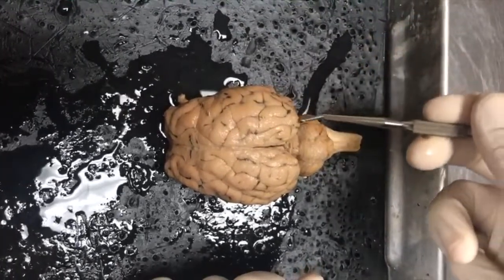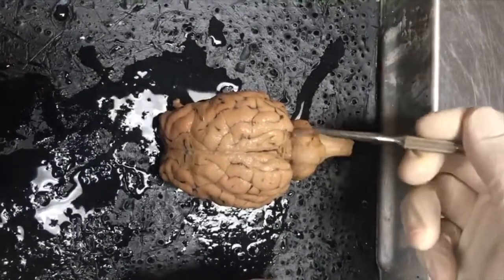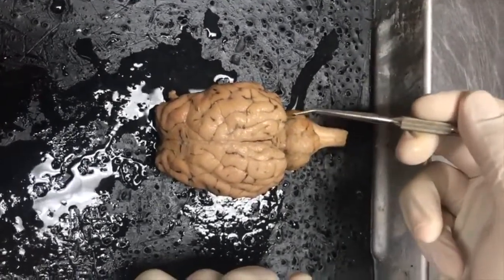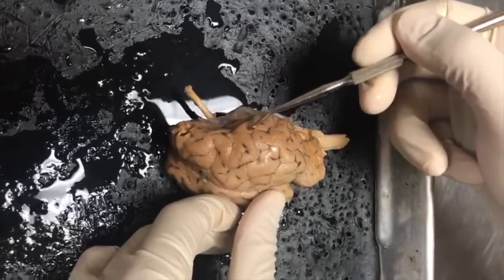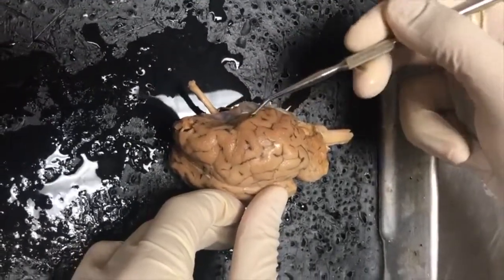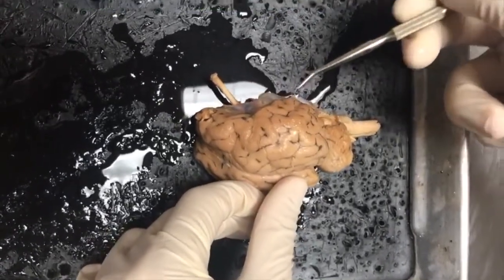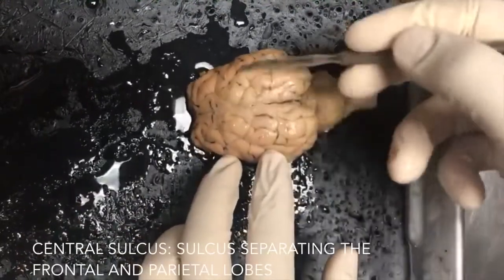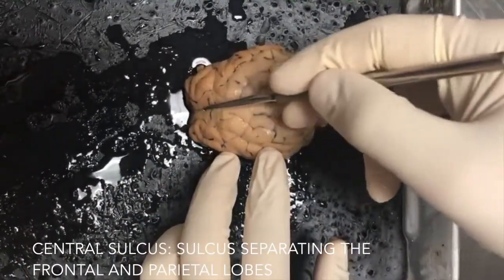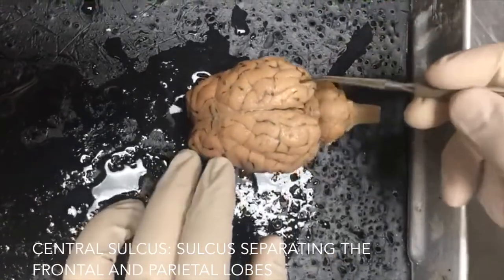Coming back further near the backside of these points, you have the occipital lobe, and that'll be primarily for visual integration. As we look to the side, this darker area right here, this is the temporal lobe, and that'll be primarily for auditory and memory function. Splitting the two hemispheres, you have the longitudinal fissure. So this area right here.